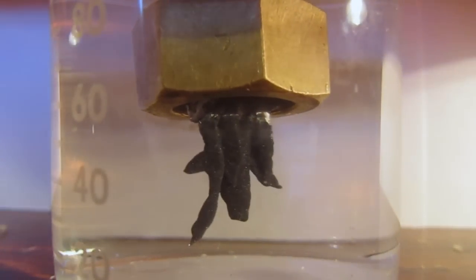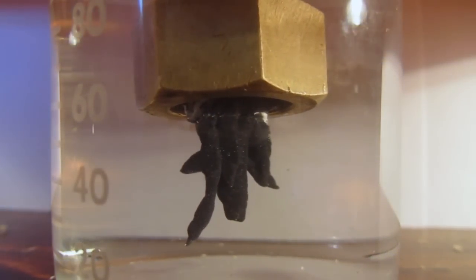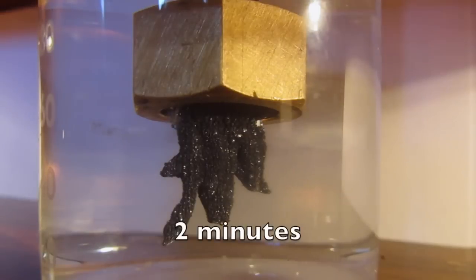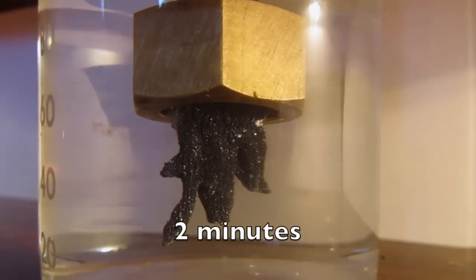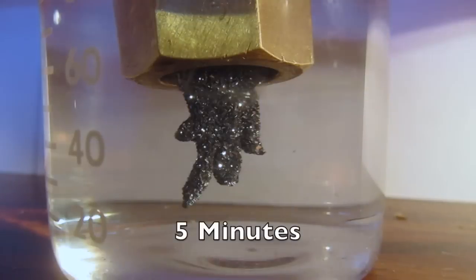You can see that the zinc instantly blackens as it's forming lead crystals on there that are becoming apparent by two minutes in, and by five minutes in I noticed a lot of small crystal faces on it.